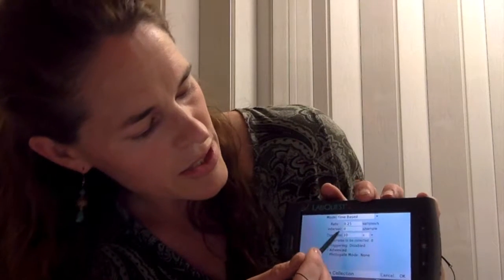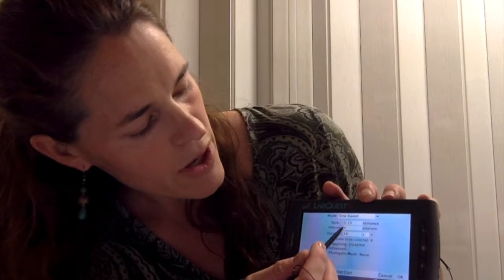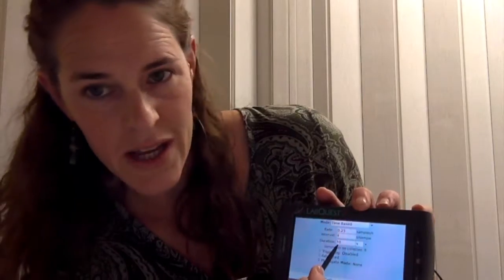I'm just going to set it to 30 seconds, and it's set to take a sample every 4 seconds right now.